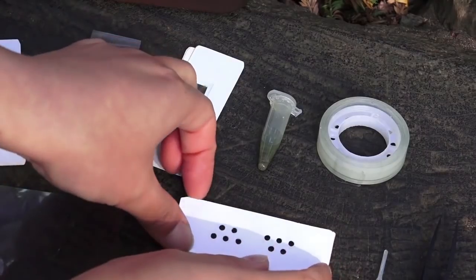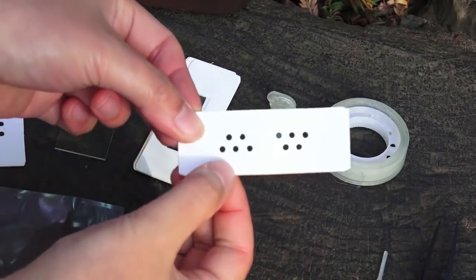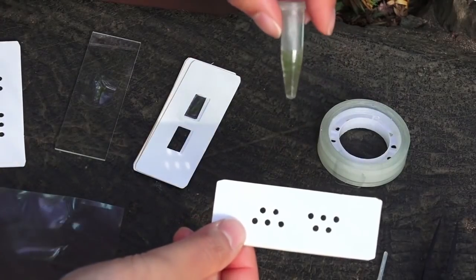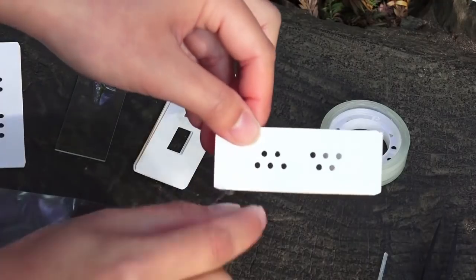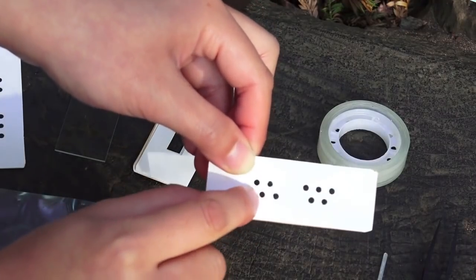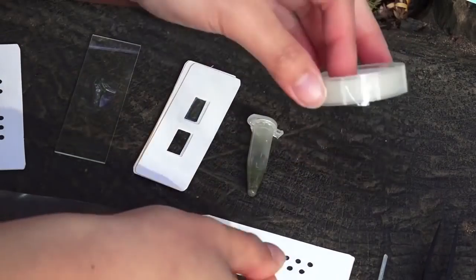Now let's practice preparing a sample with a micro well paper slides. These are great for pond water samples which I have here. And if there are any swimmers in here, they get trapped in these tiny wells so that you can see them clearly.